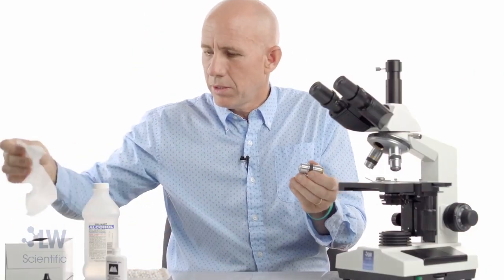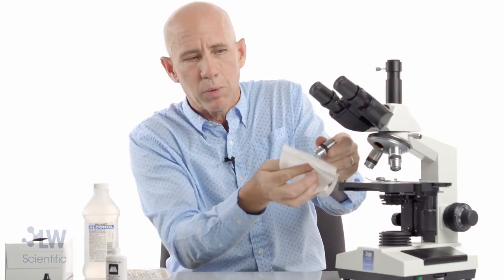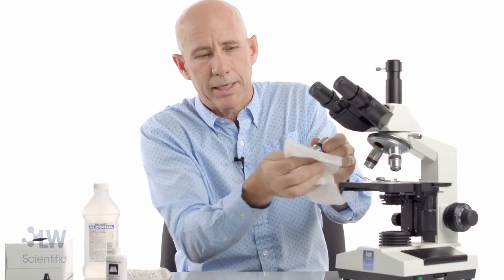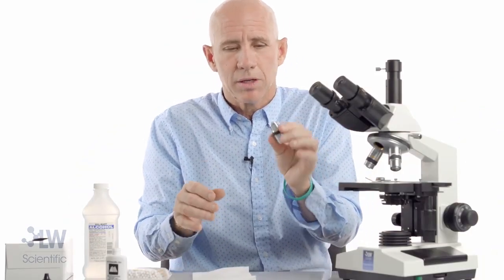Customers often tell me they clean it every day. What they do is just wipe, wipe, wipe while it's on the microscope — they got some fluid and cleaned it, and the next day they cleaned it the other way. But it's still blurry, and it's still dirty, because you can't see that little lens very well.